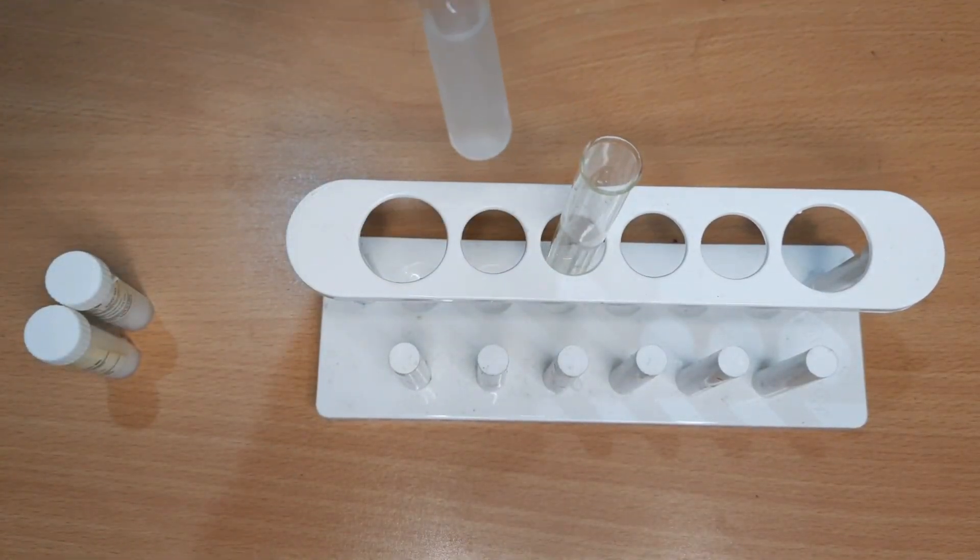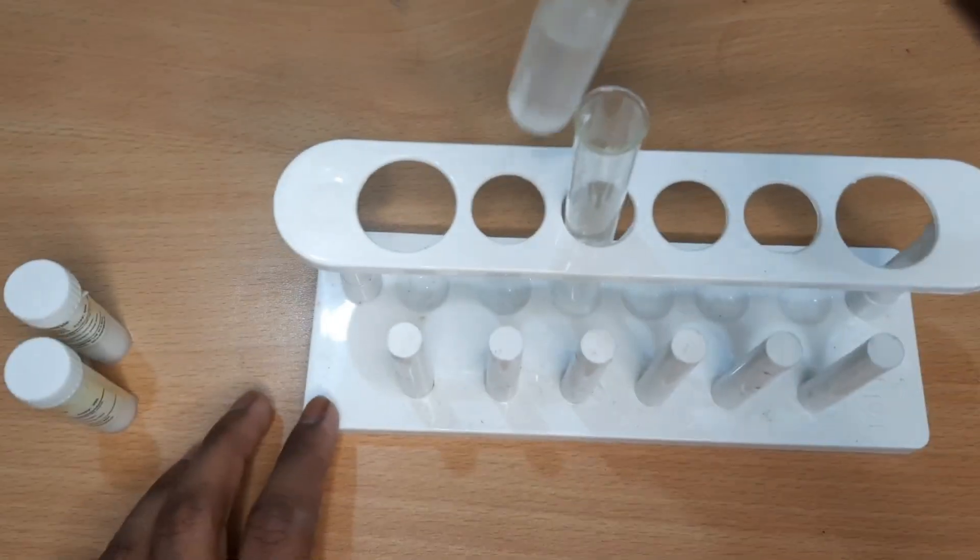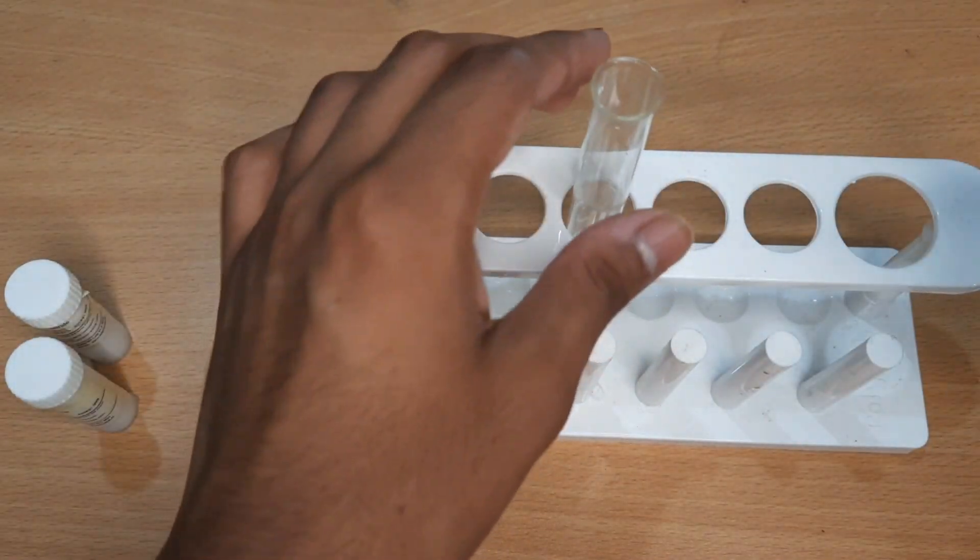Barium chloride solution and sodium sulfate solution are colorless. Add barium chloride solution to sodium sulfate solution.